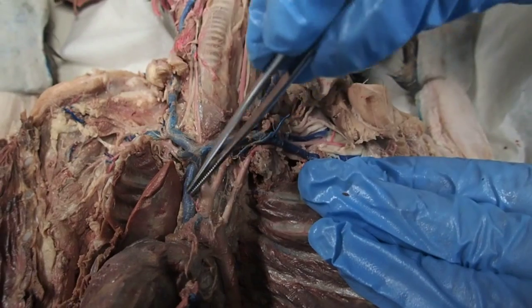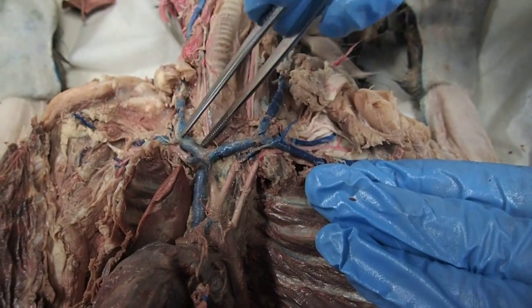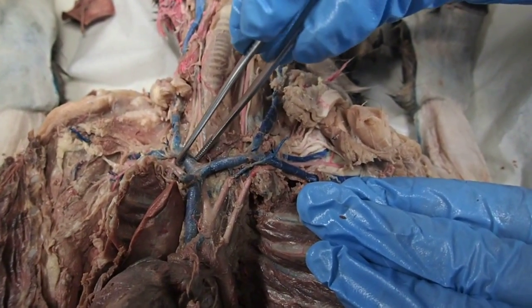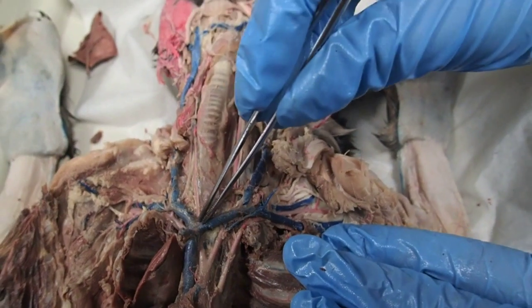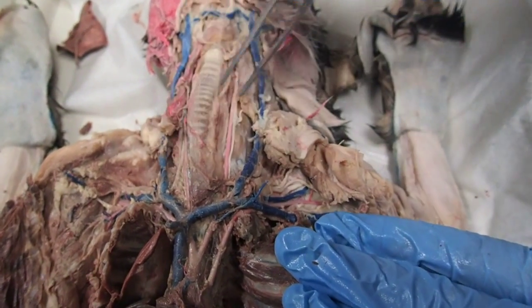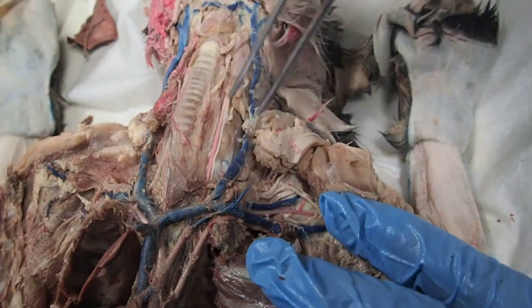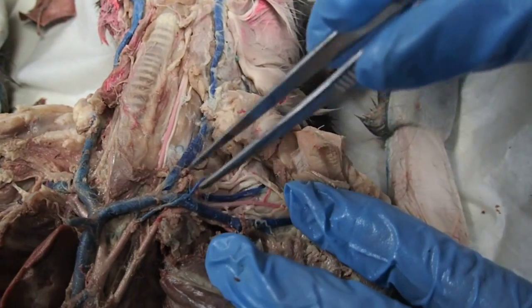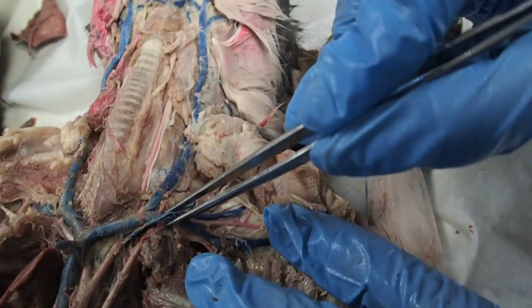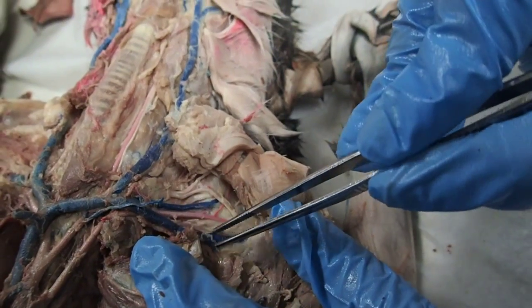Then it Y's into the two brachiocephalic veins. The part going up to the head is the jugular vein. The part going to the arm is the subclavian vein. Then the one going even farther into the arm would be the axillary.